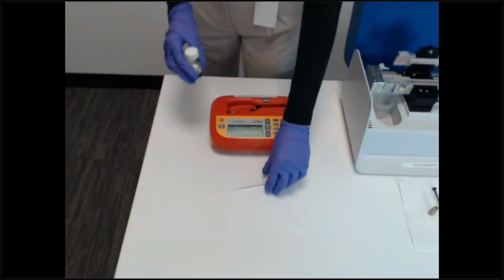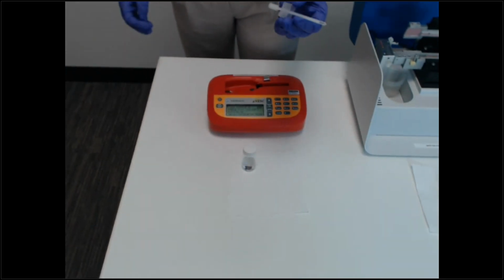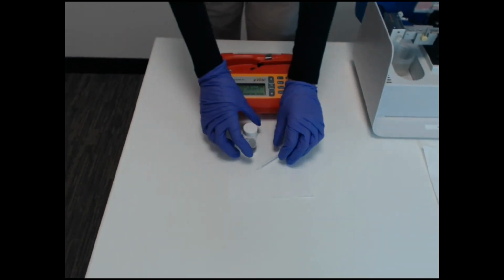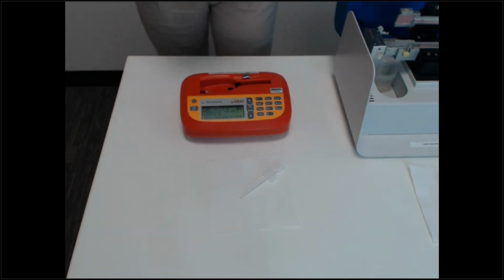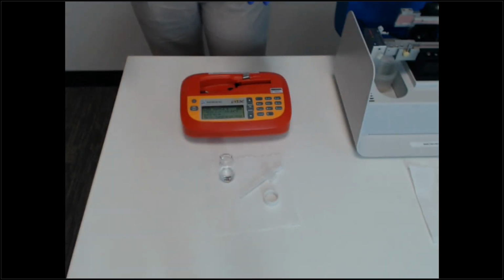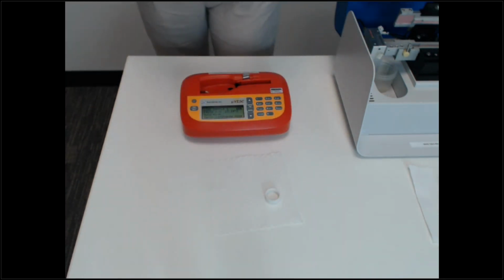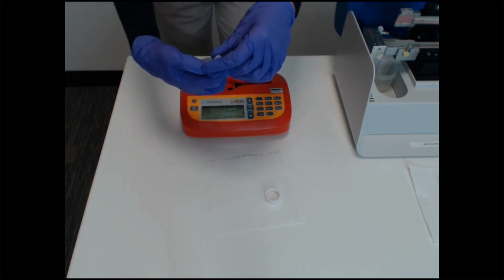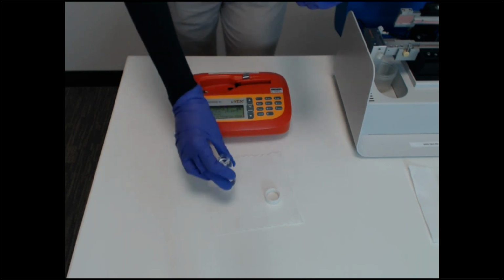So the Microvis minimum volume is 100 microliters. The pipettes hold about 400 microliters, and it is just a flow-through system. So it will just flow straight to waste. What's different of the Microvis compared to our other instruments is that you don't have to use the software. You can operate it just from the screen here. So I'm going to load roughly 100 microliters. As I said, these pipettes fit about 400, so about 1/4 the pipette.